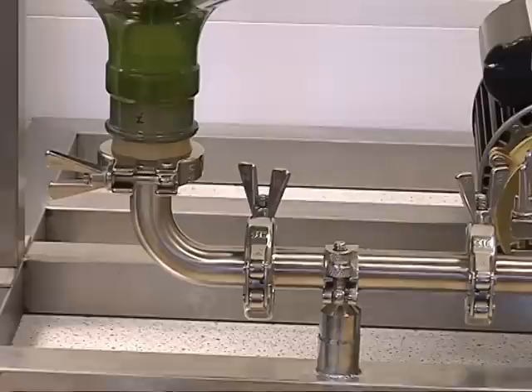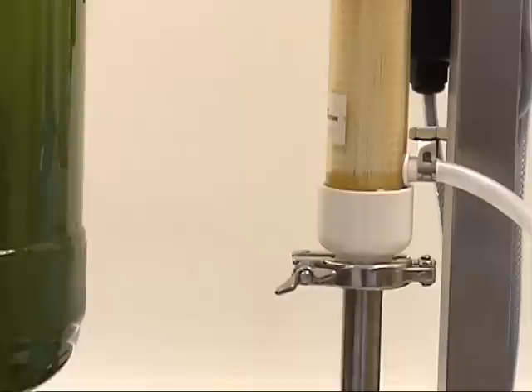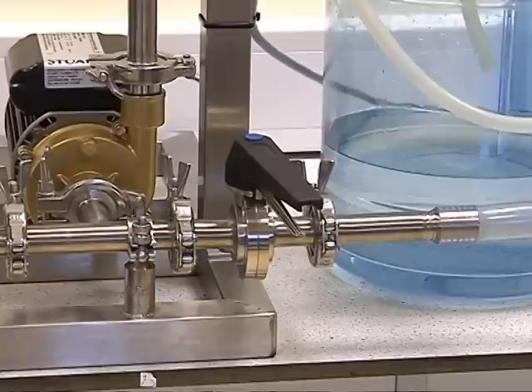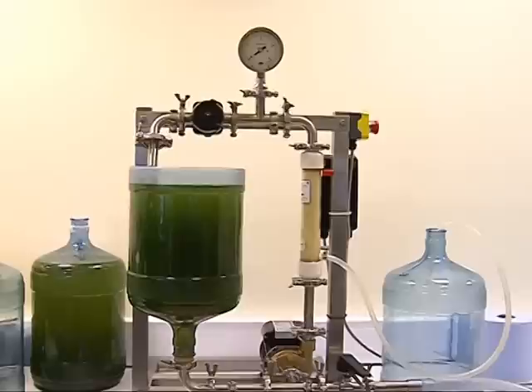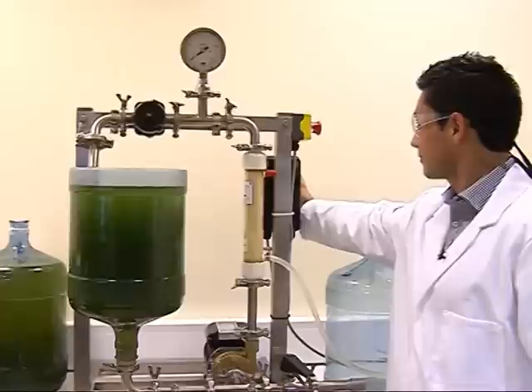Now that we know a little bit more about membrane filtration, let's see how we can operate this small scale cross-flow microfiltration system using algae. Hygienic stainless steel fittings are used and allow customization of the rig. A centrifugal pump provides flow around the loop and there is a membrane cartridge with a 0.2 micron pore size. A pressure gauge reads the membrane outlet and a valve regulates that pressure. There is also a drainage point to collect the final concentrated product. Maximum capacity is 20 liters, and the minimum volume is roughly one liter due to suction of air into the system and consequent cavitation of the pump.